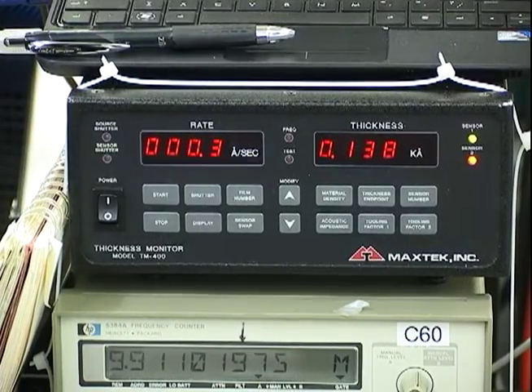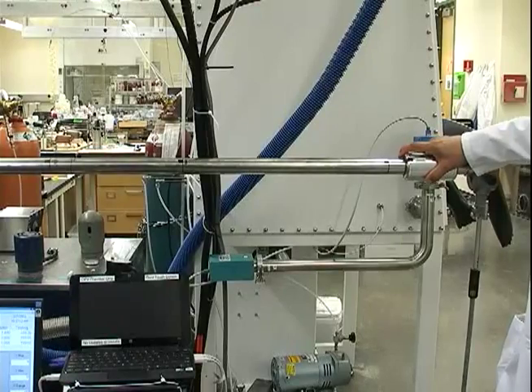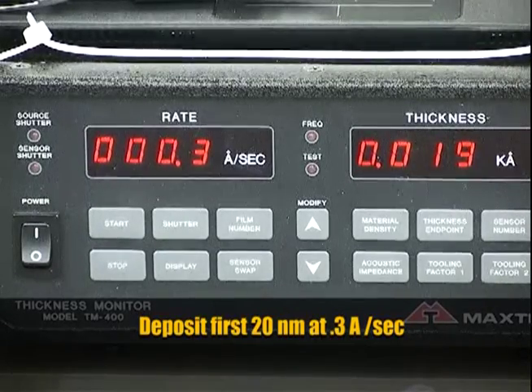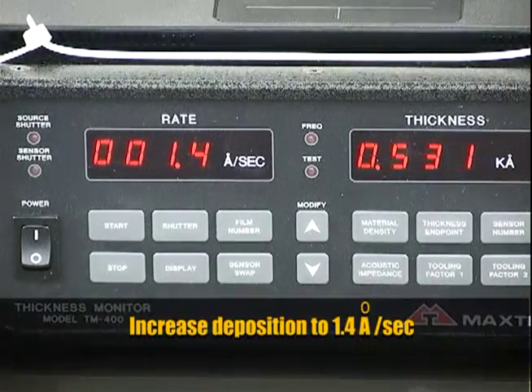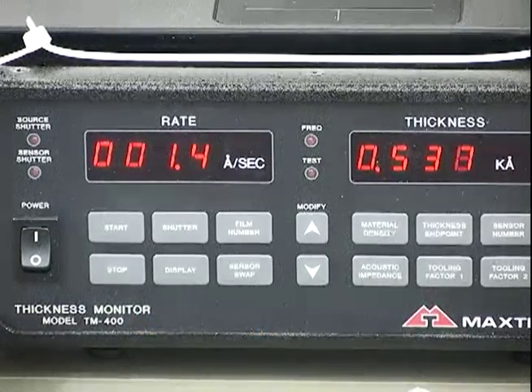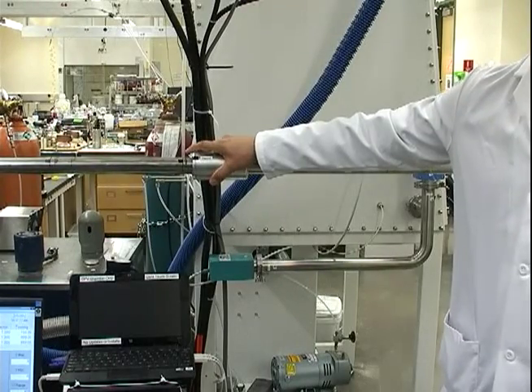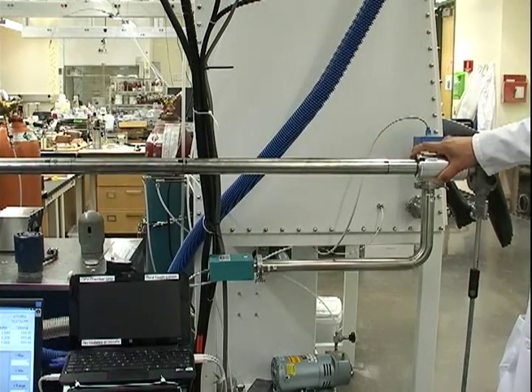Once we're ready to deposit, we reach a deposition rate of 0.3 angstroms per second and slide our substrate into position. We deposit the first 20 nanometers at 0.3 angstroms per second to avoid damaging any organics. After the first 20 nanometers, we increase our deposition rate to about 1.4 to 1.5 angstroms per second and complete the final 80 nanometers. Once deposition is complete, we withdraw our substrate and allow it to cool down.